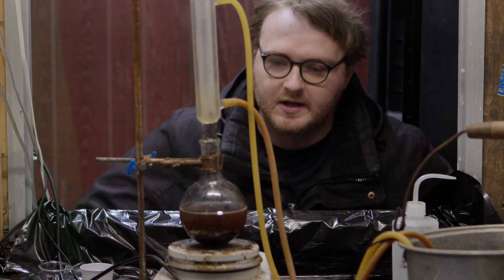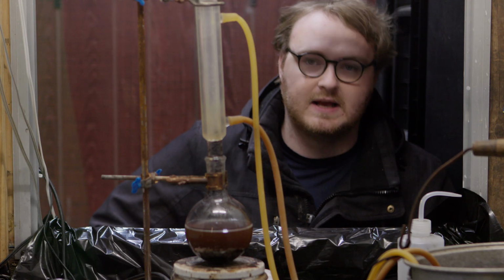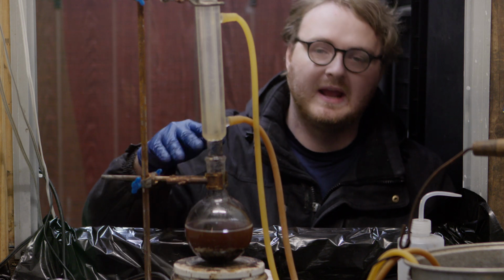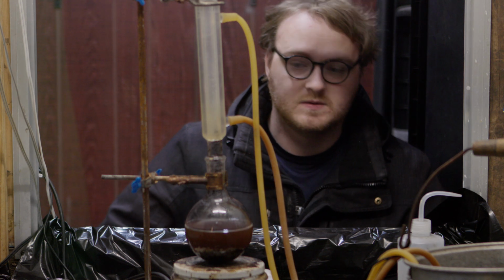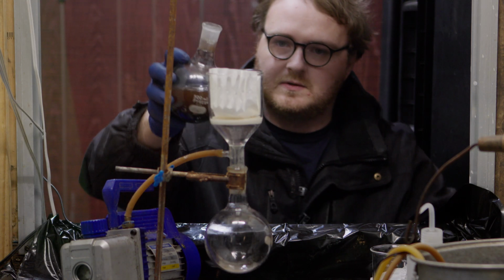Okay, so after several hours of reacting, we are now back, and you'll notice that the color has changed from a pinkish purple, bluish color to brown. That means that all the potassium permanganate has changed oxidation states, and basically now it's all solid brown manganese dioxide, which doesn't dissolve in the water. It's just sort of sediments that are floating around in there. So to remove the manganese dioxide, we are going to filter it off. Shouldn't be that difficult.